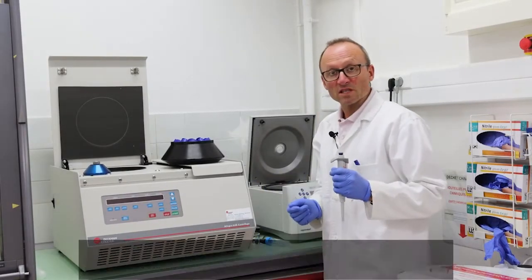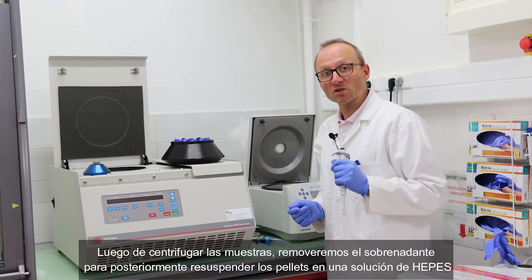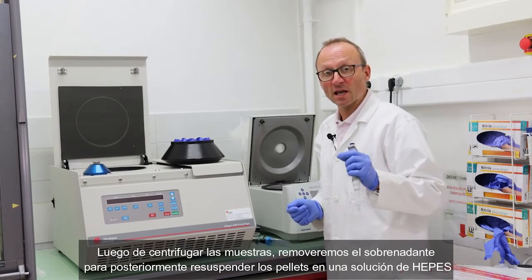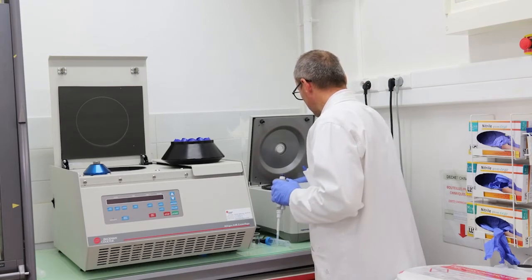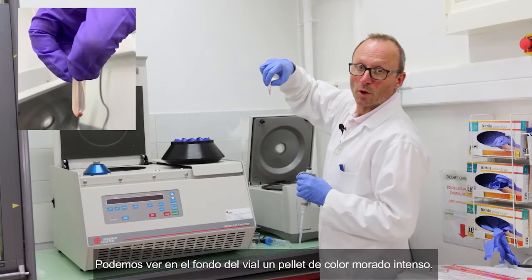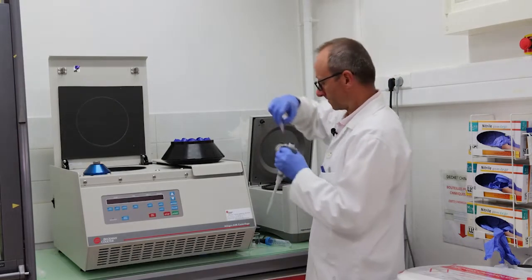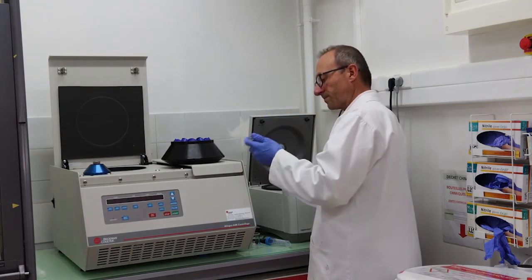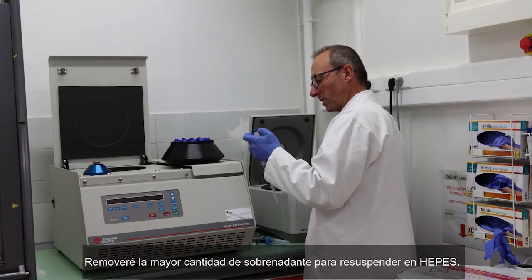Well, now the reaction is completed. So we centrifuged the samples, we will remove the supernatant and then resuspend the pellets in a HEPES solution. So you can see the deep purple or red pellet at the bottom. I remove the maximum volume of supernatants.